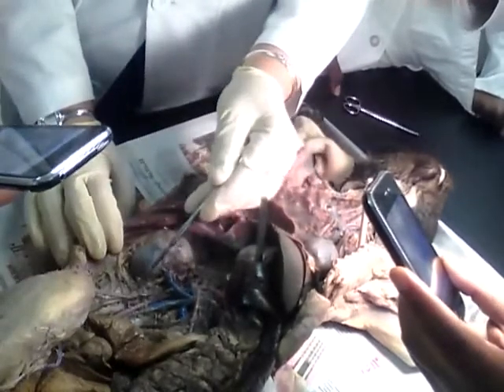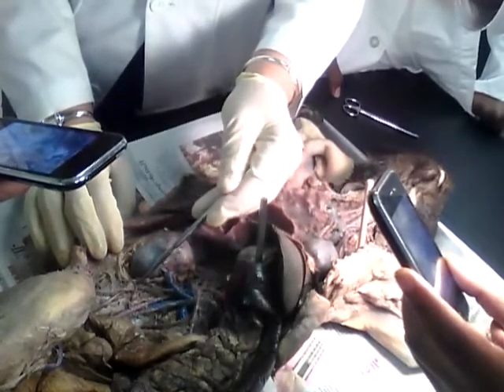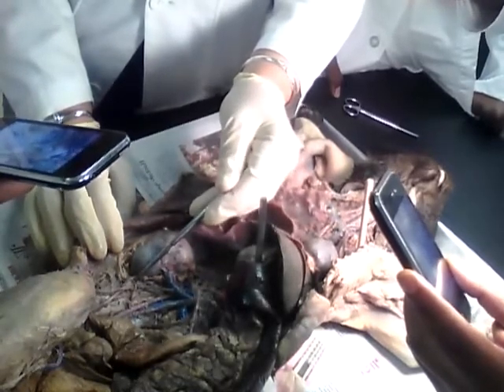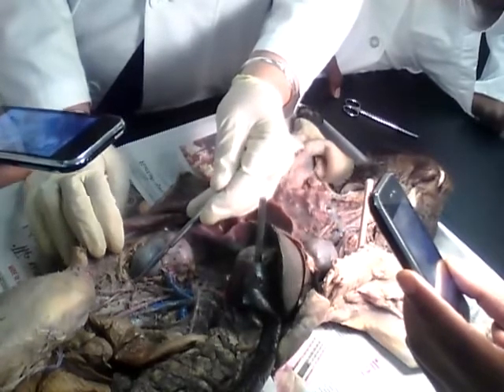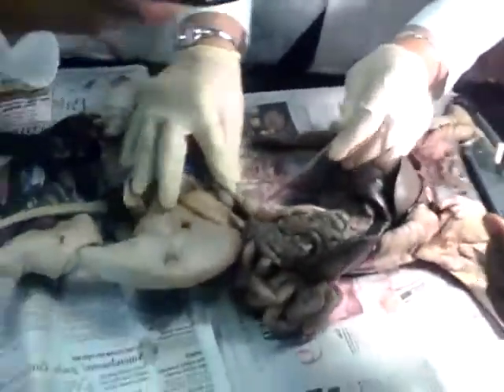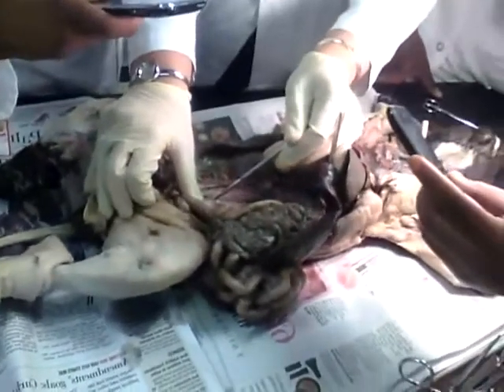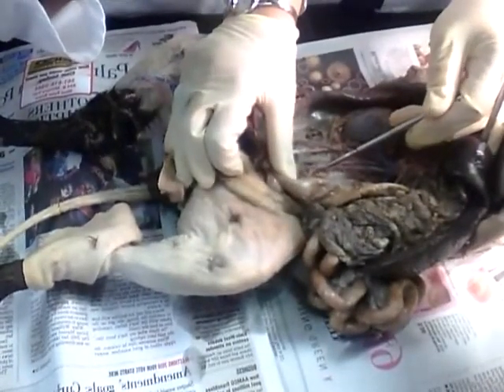Then one is going to go into the gonads, and it's going to be called gonadal. If it's a female, it's going to be called ovarian. And if it's a male, it's going to be called spermatic. Very good. Now let's go on. Now here we encounter this one. What's the name of this one? Inferior mesenteric artery.